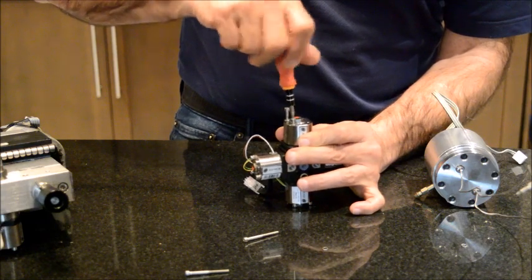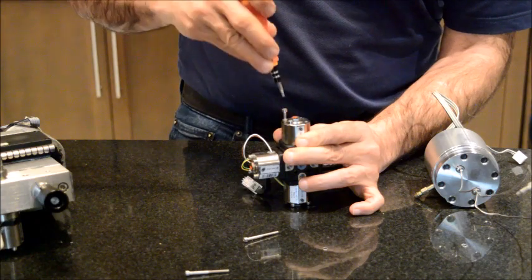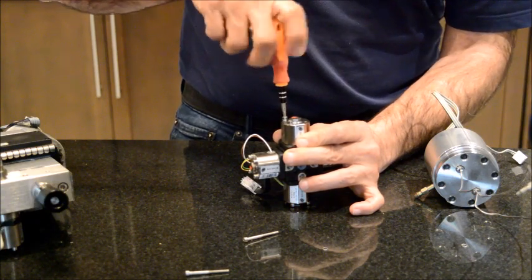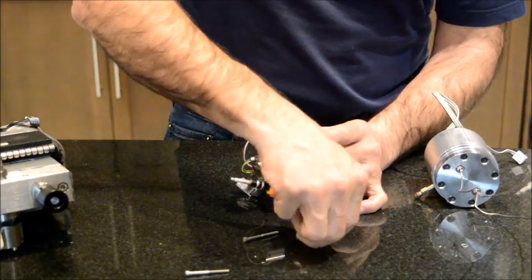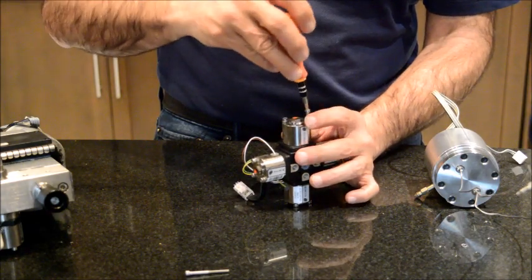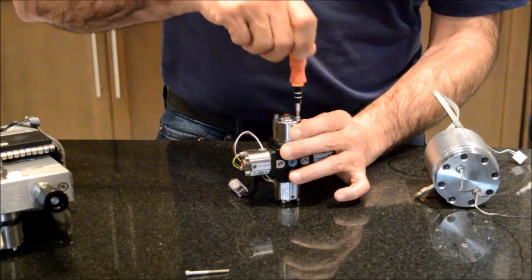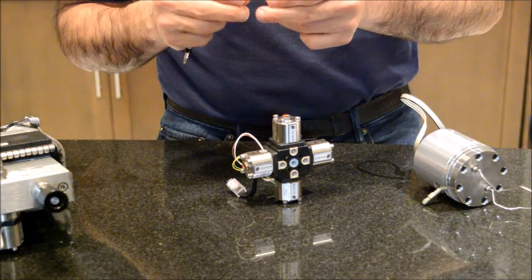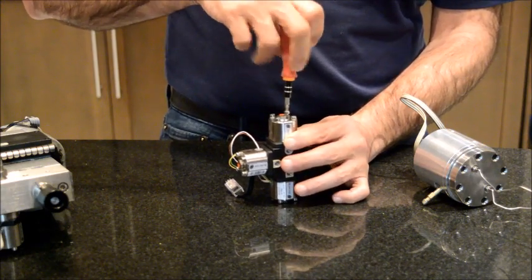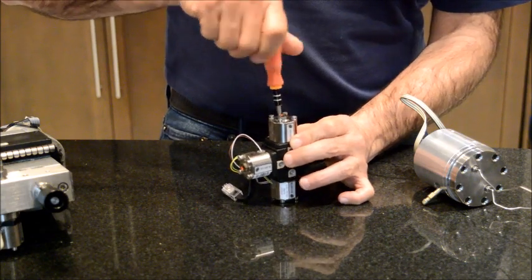As I said, probably your option of washing is your first choice. Replacing the unit with a brand new one is costly—it is the easiest as I said—and designating the system to be used like C and D is not a bad choice. What I just showed you by replacing these components, it is tricky. I've looked at the website, I did not see Agilent even supplying these components or parts as a replacement, as if Agilent has already decided that you should buy the whole unit. Even finding those three small pieces—the membrane, a sapphire sphere, and the little cone-shaped plastic—probably you have to salvage it from the old parts you tossed in the garbage. I'm not sure if you put this right together you will pass the gradient proportion valve test. But anyway, if the unit doesn't work, what worse could it get? It doesn't work, so you have nothing to lose. This is for people who like to experiment.